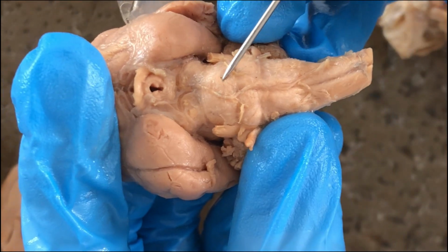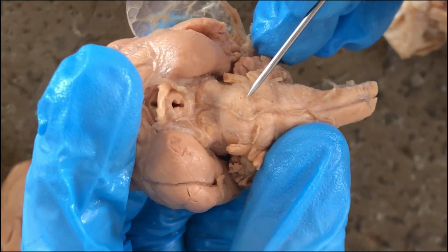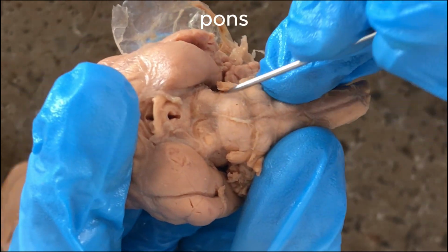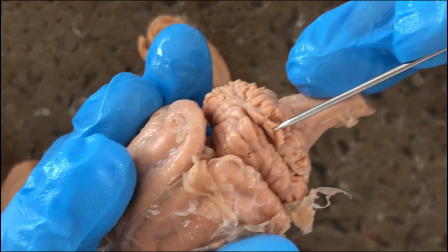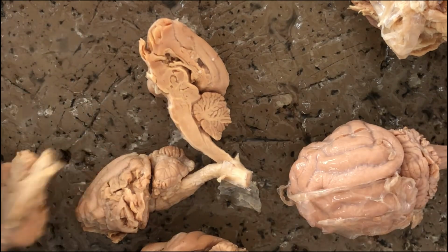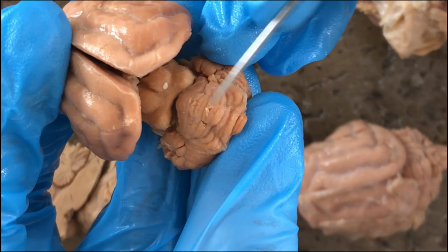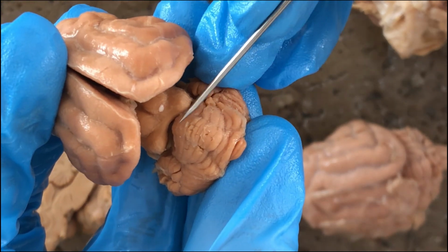And this one is not part of the midbrain anymore, that's part of the hindbrain, specifically the metencephalon. So that would be the pons. Another part of the metencephalon would be the cerebellum. And the cerebellum has a median worm-like structure called the vermis, literally the worm of the cerebellum.